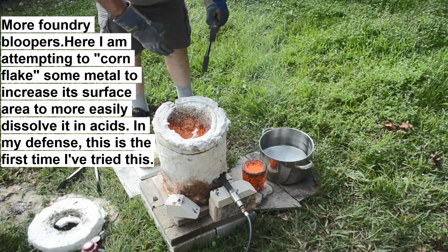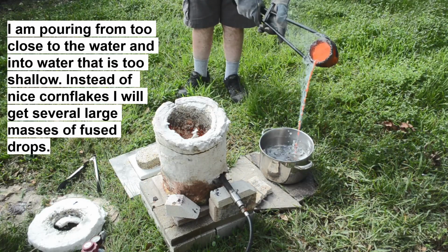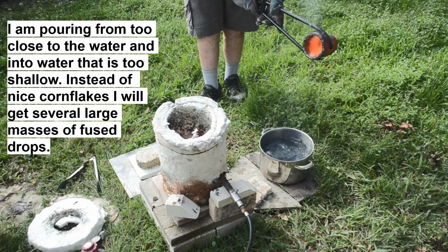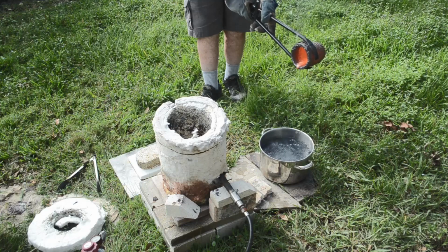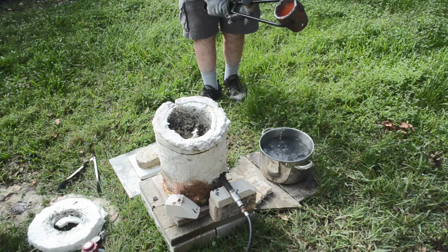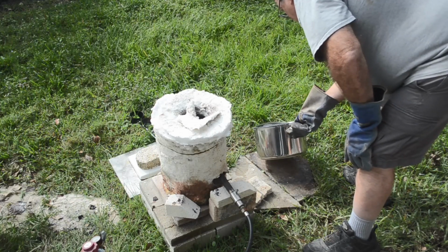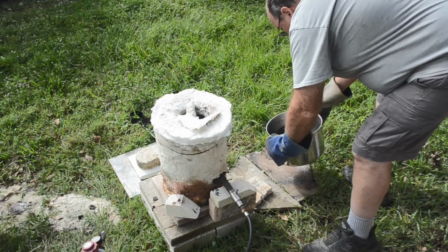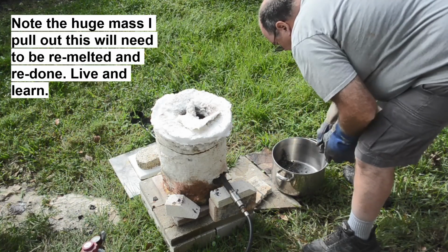One hot crucible. All right. Let's see what we got. Oh yeah. We got us some corn flakes. And there's a couple big chunks in there too.